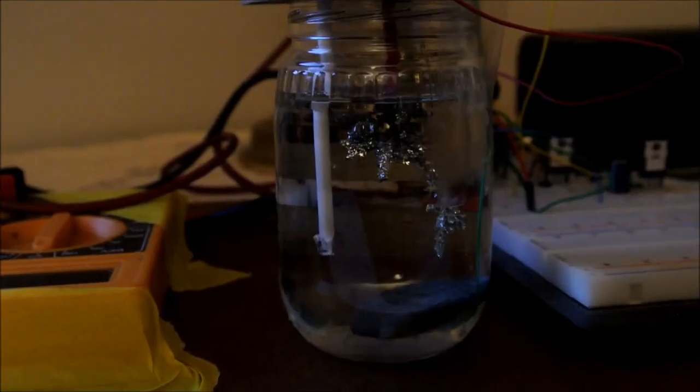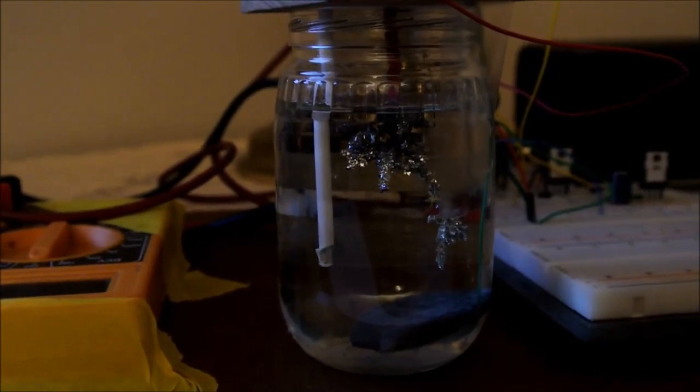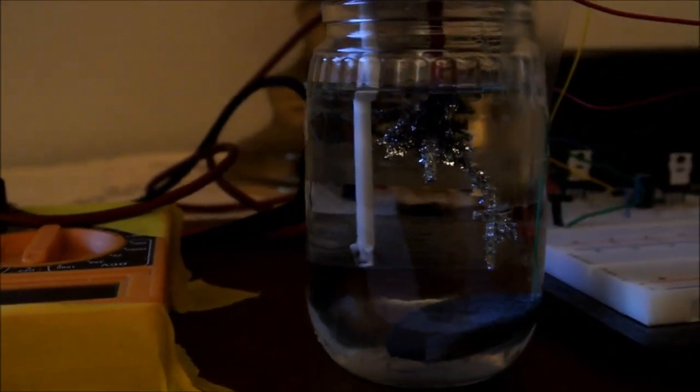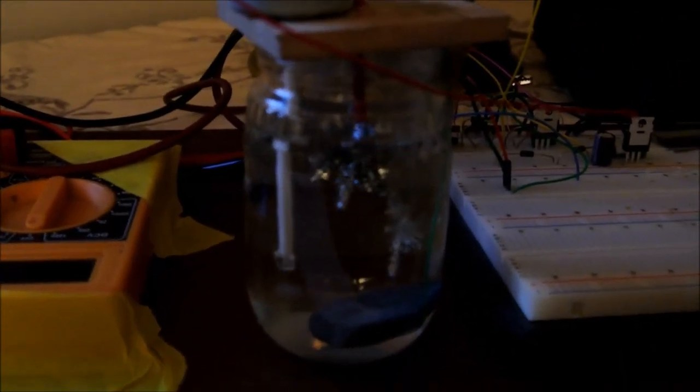Well, it looks like the crystal is growing quite close to the anode, and it also looks like there are some nice, flat, shiny crystal faces. So I think it is time to unplug it and wash it off.